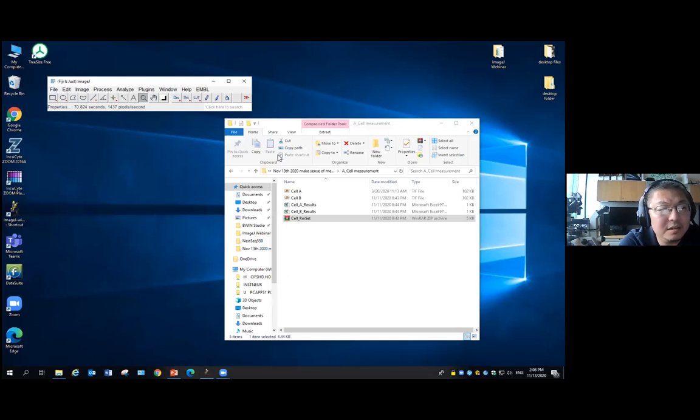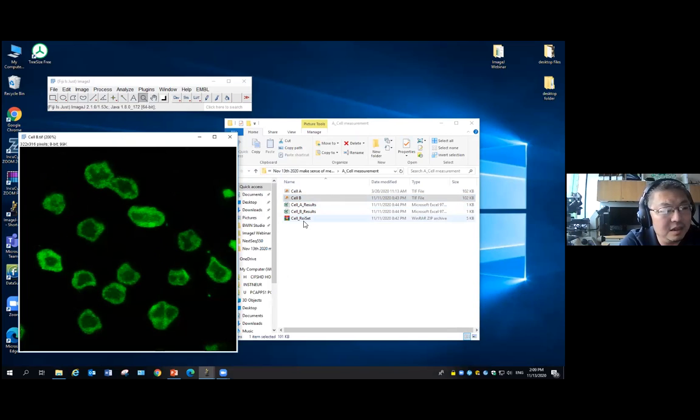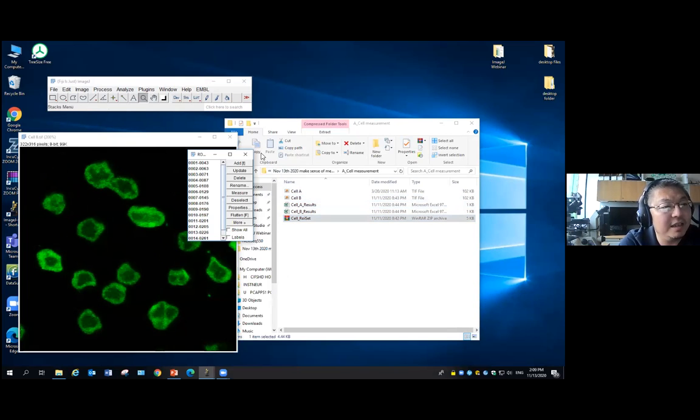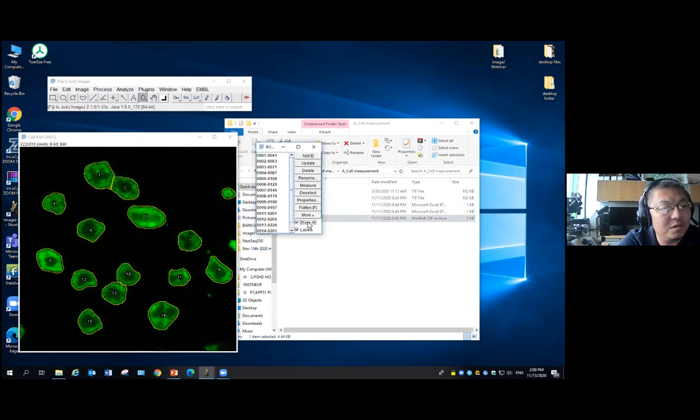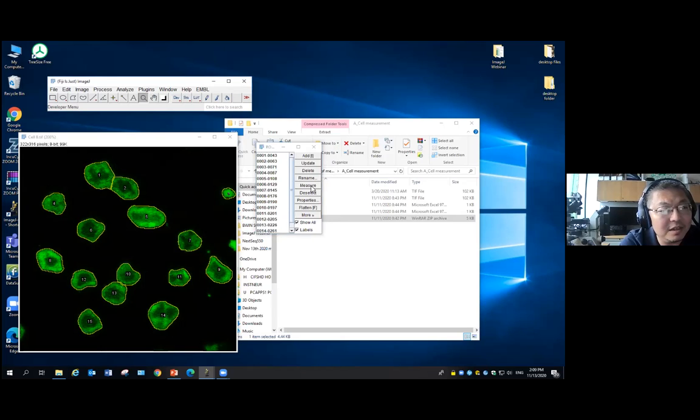So let's change this. Sometimes, let's say I open another one, they call cell B. I open this one. It looks the same. I open the ROI. That's all the cells we checked. I check the set measurement. I still measure the size, mean intensity, and the total intensity. Now I click OK. Now I do the measurement.